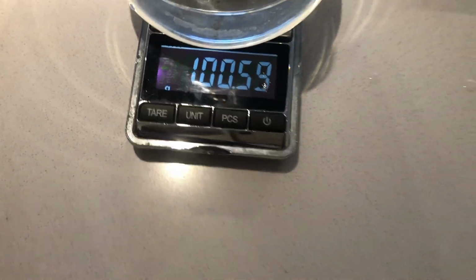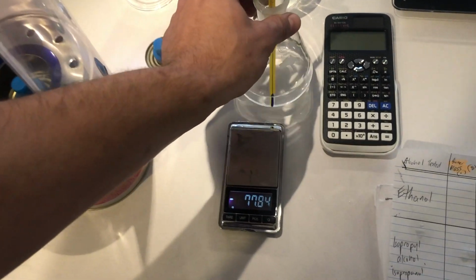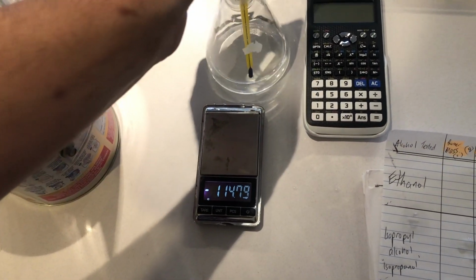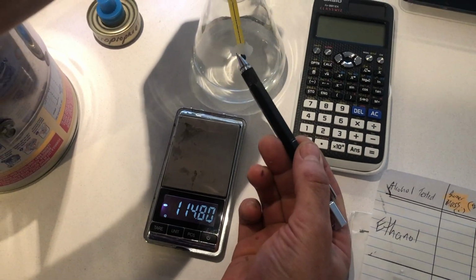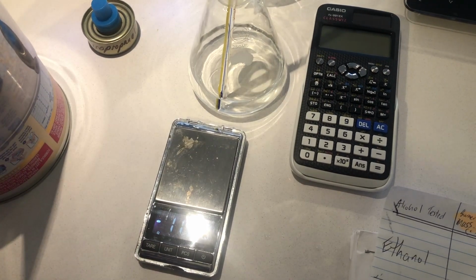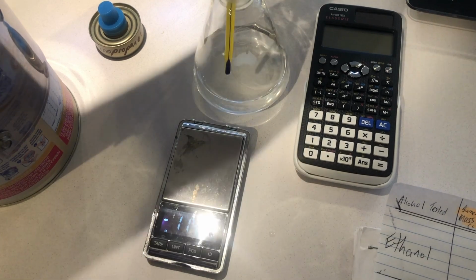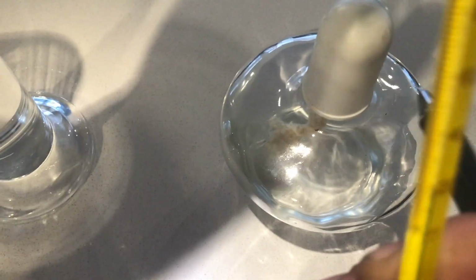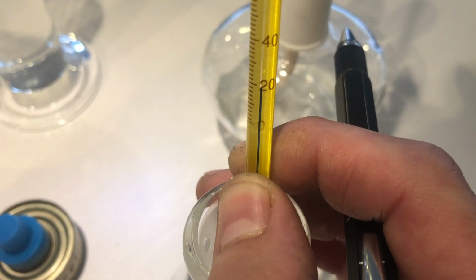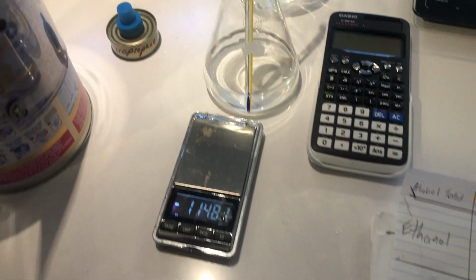Okay. Now we've got that measurement, we're ready to start getting the initial temperature. It's good that we did this first rather than measure the fuel, because thermometers measure the temperature of themselves. In order for it to measure the temperature of the water, it needs to get into equilibrium with the water, the same stable initial temperature. So wait until that stops changing. Currently it says about 18, and we'll see if it drops any further in order to stabilize.